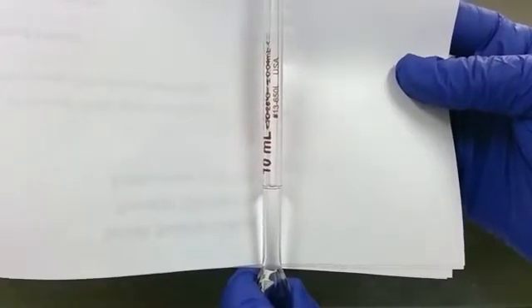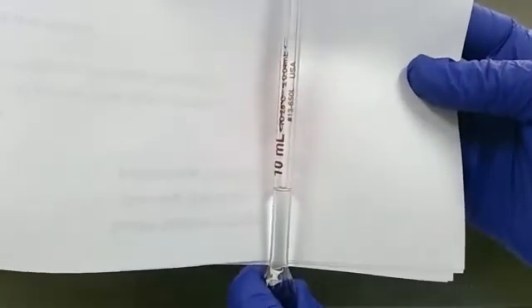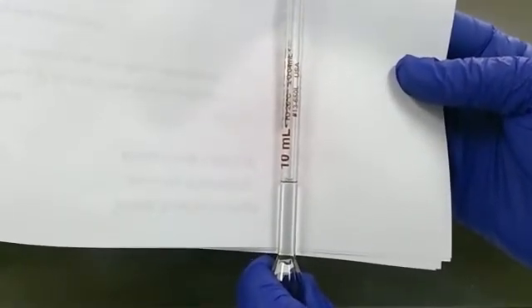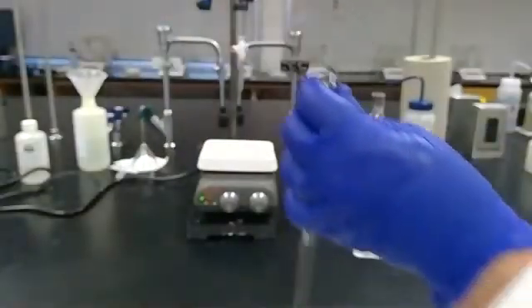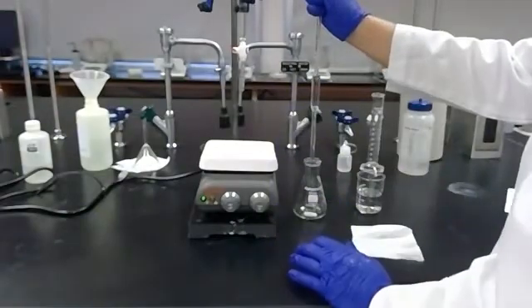We have the meniscus right, the bottom of the meniscus right on the line. So that should be about 10.00. Now I'm going to deliver that into my Erlenmeyer flask.